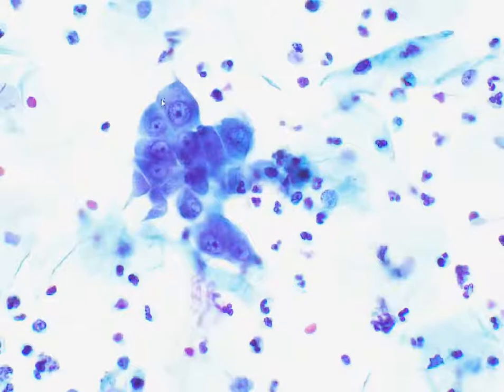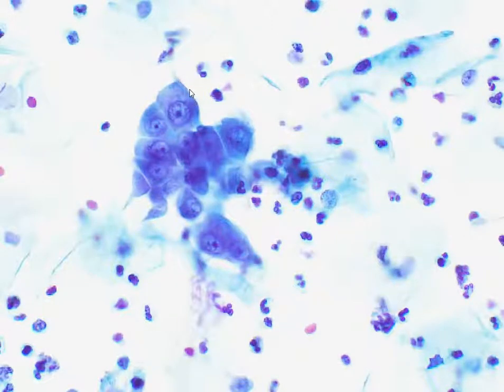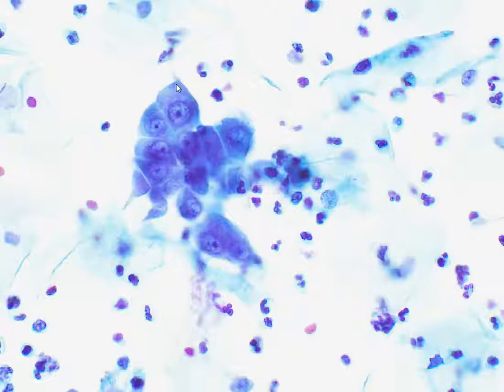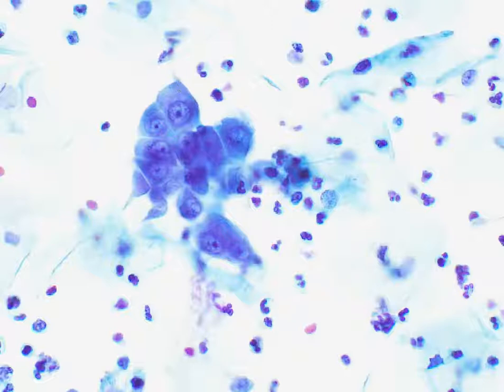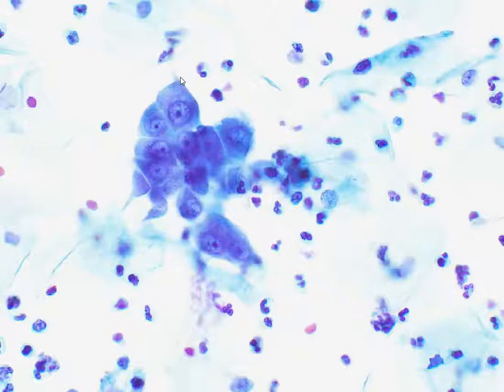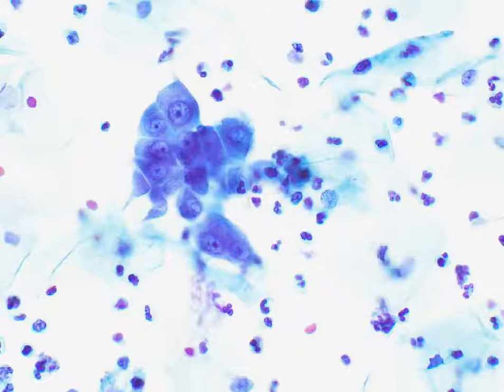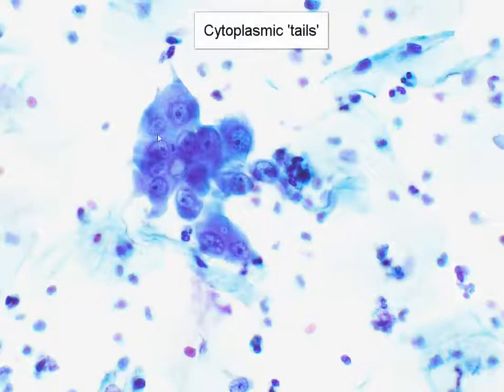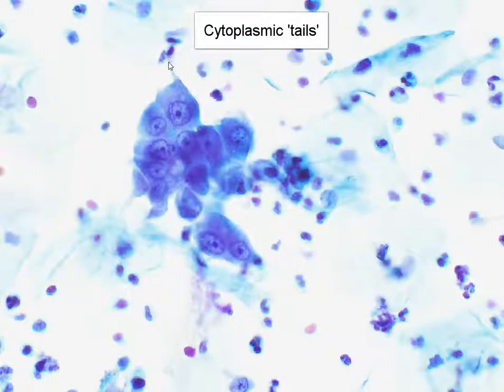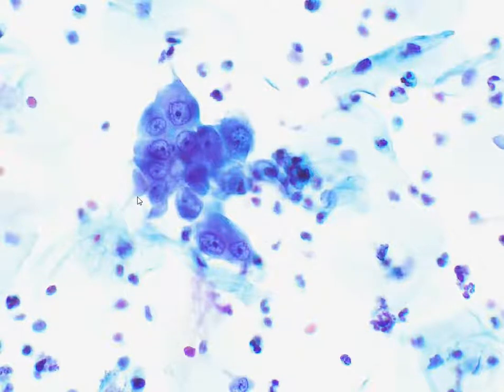The cytoplasm is still quite abundant and fairly dense. And sometimes in repair or reactive cell groups, we can actually see these little cytoplasmic tails that appear to have a sharp, pointy shape.